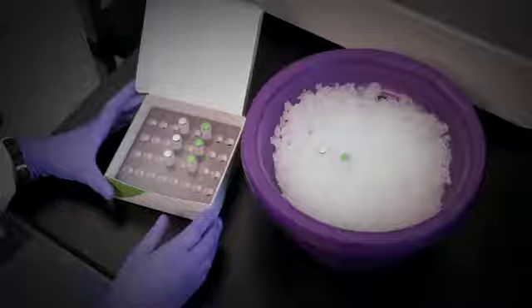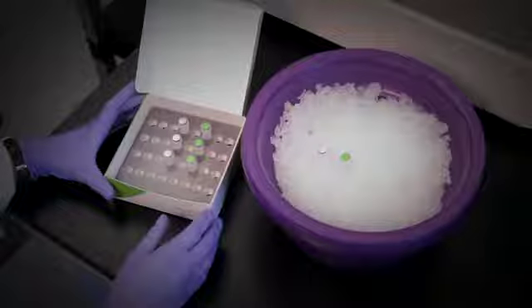Note that the capture probe and reporter probe are supplied in separate tubes and that each tube is enough to set up 12 hybridizations.